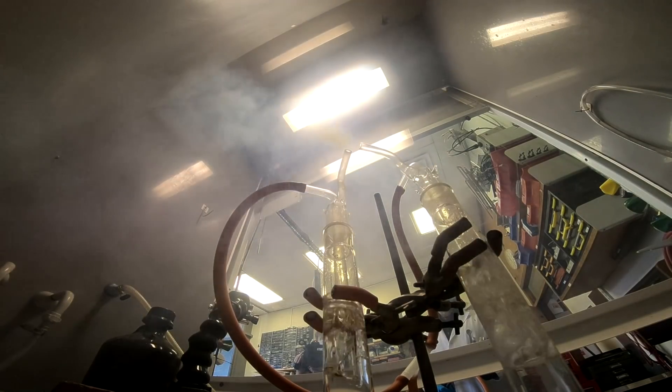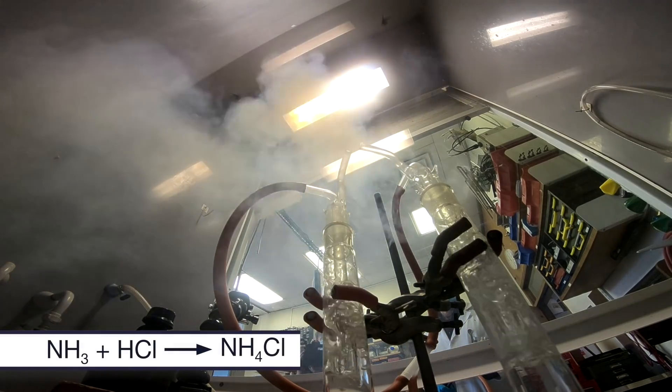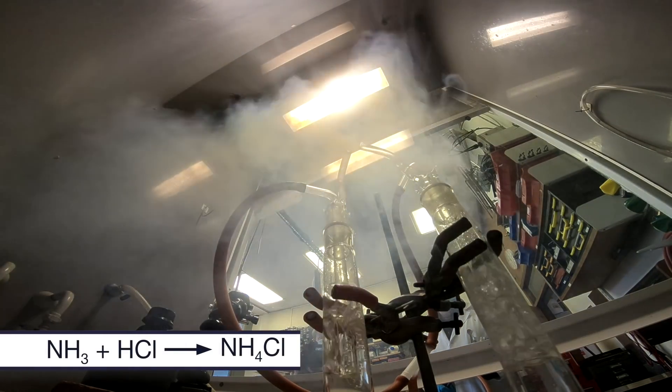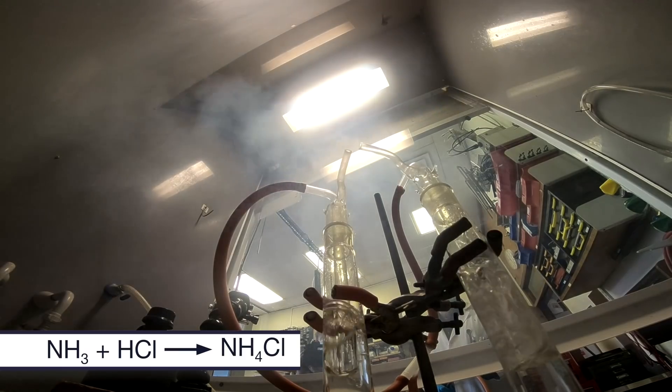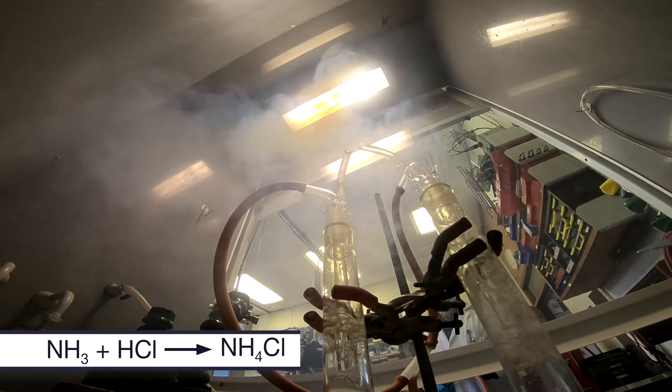And in order to demonstrate it better, Neil decided not to have the fume hood switched on until the fumes were coming out. And then when the fume hood was filling up he switched on the fan and you can see these things swirling around.